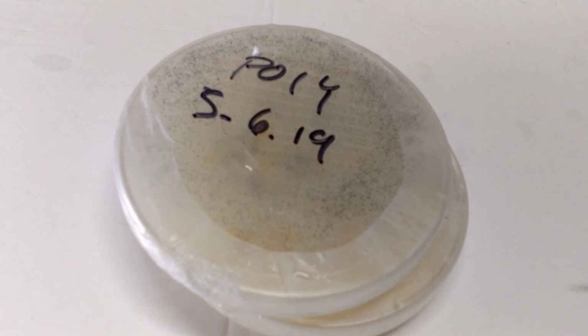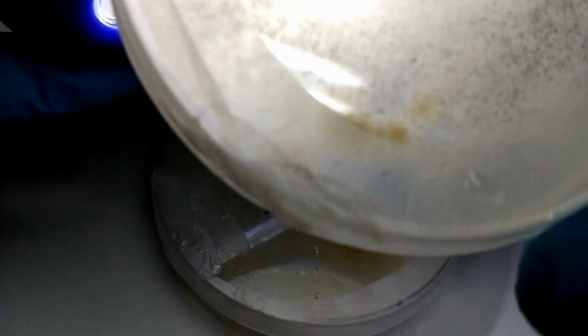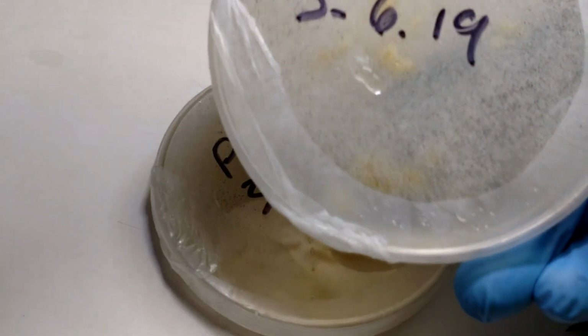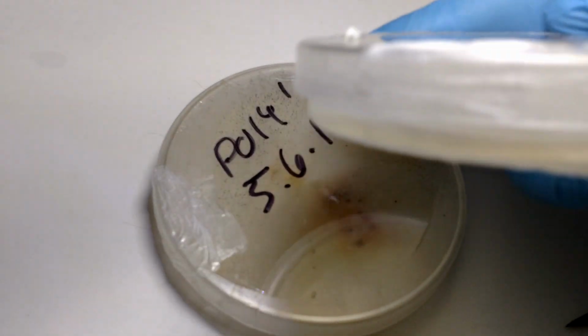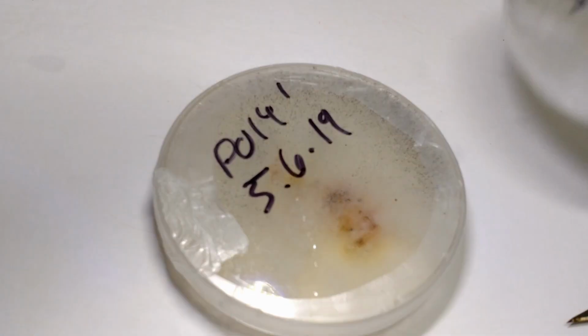We're going to look at the ugly stuff, see what your contaminants actually look like. This dish is horrible. It's hard to see because this will fool you a lot of times because it's sort of white until, looks like it might be starting to sporulate or sprout right there. This is cobweb. It's actually three-dimensional. Wow, that's really cool. You can see the little black head. I'm going to show you that in a second.